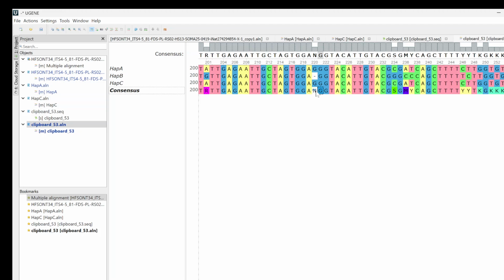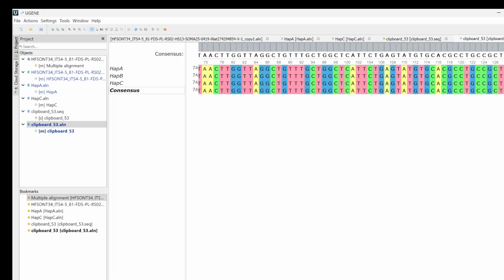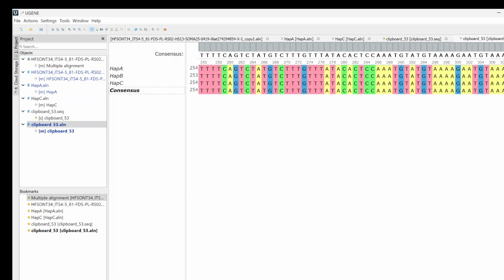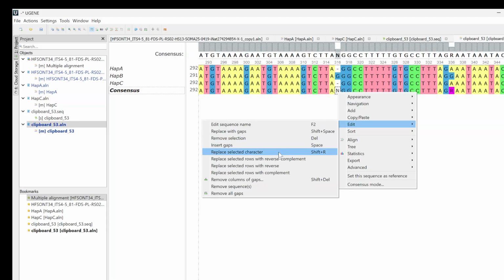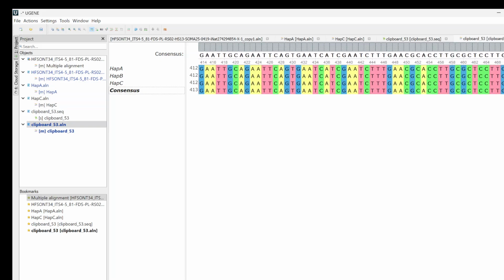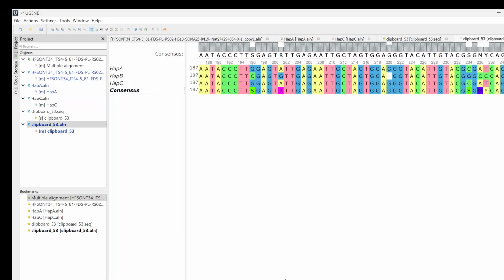And then what we can do is we can highlight that N and edit, replace selected character, and we can replace it with a G. And we can do that anywhere there's an N. I'm looking in the wrong place. Here's one. And so basically I'm making the longest length here. So anytime there's a space, I'm filling it with whatever nucleotide exists in at least one of the haplotypes. Because there's no way of communicating that it's either a space or a nucleotide.